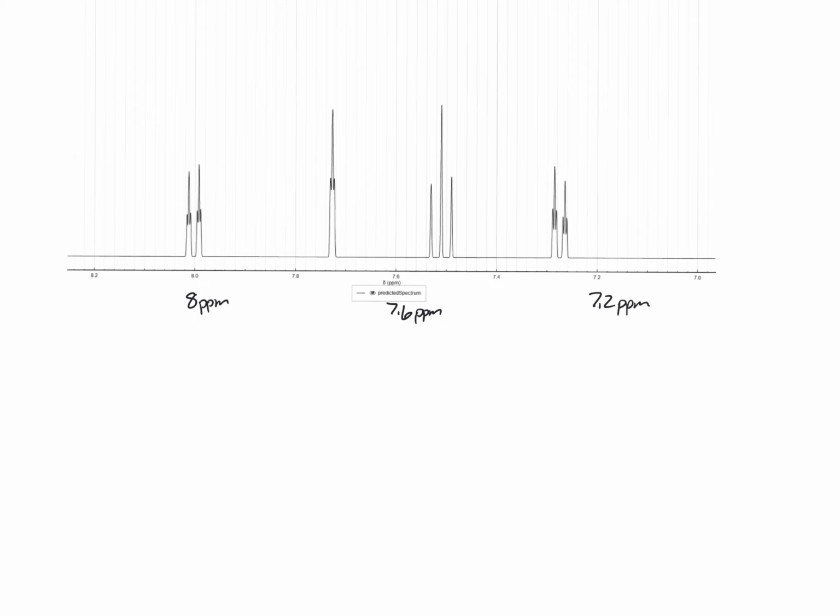All right, a few things we want to observe here. We've got, let's see, this would be called a doublet of triplets. This would be called a doublet of triplets as well. Now remember that a doublet of triplets means that the hydrogen that created this signal has both a single nearest neighbor and 2 nearest neighbors. So it actually has 3 nearest neighbors, which would make sense if we had 4 hydrogens on a ring. This was one of them. It would have 3 other hydrogens on that same ring.